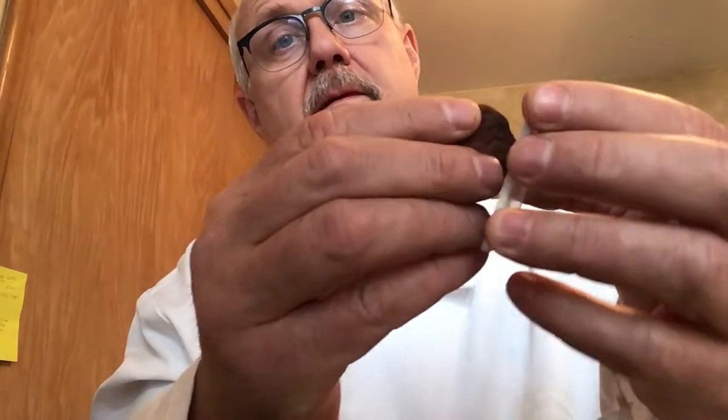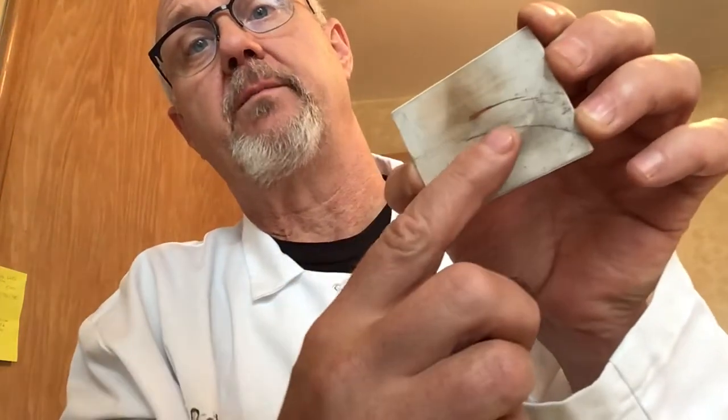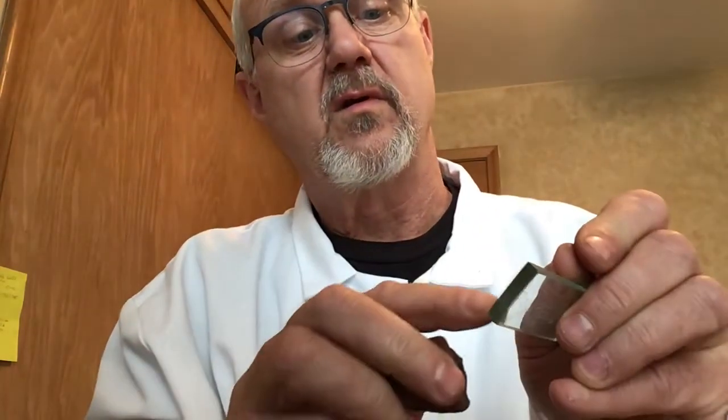All right. It is reddish in color. Let's look at its streak. Oh, look at that. Big old reddish streak. And hard or soft. Well, in order to speed things up, I'm not going to test all of them. I'll just go fingernail. Nope. Will it scratch the glass? Oh, it did scratch the glass. This is definitely a hard one. So, number 3 was hard.